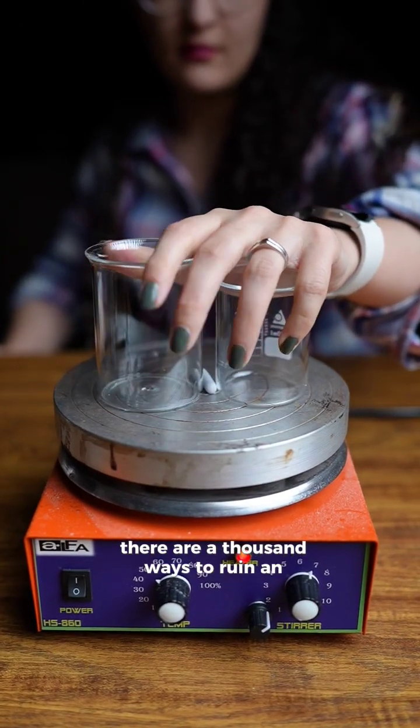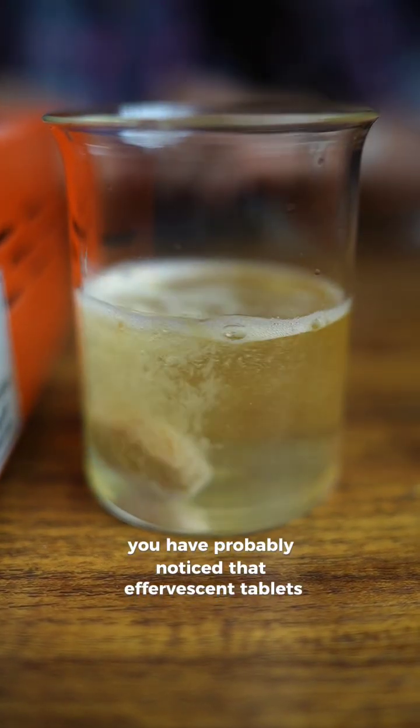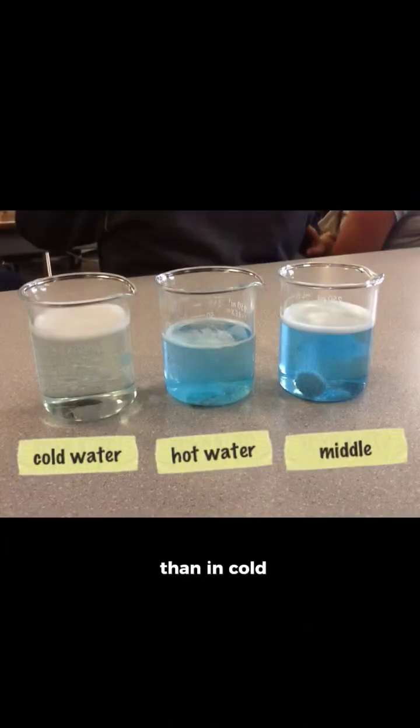There are a thousand ways to ruin an experiment and today I present one. You have probably noticed that effervescent tablets dissolve faster in warm water than in cold.